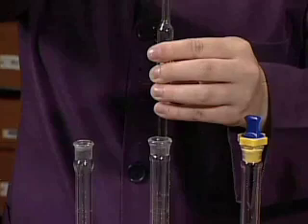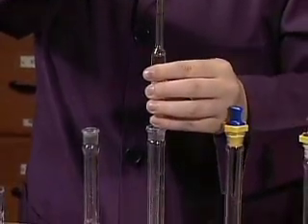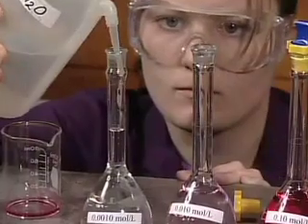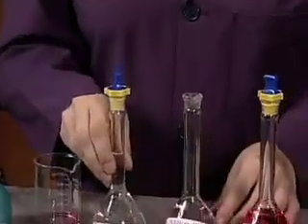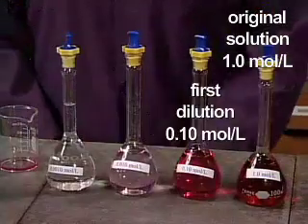A third dilution produces a solution with 1/1000th the concentration of the original solution. The intensity of the color of solution decreases with each tenfold dilution.